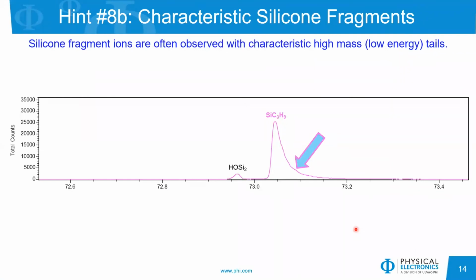Characteristic silicone fragments, generally when you look at the mass spectrum, so this is the C3H9Si peak at a mass to charge ratio of 73, a nominal mass of 73. And you'll generally notice that it has a tail on the high mass side. And this is a very typical observation of some of these silicone fragment ions. It is due to the fact that the larger ions will fall apart in the field-free region of the mass spectrometer. And those have a lower kinetic energy than the ion that shows up at the correct mass to charge ratio. So some of those, the post-source decay, will give this tail to the high mass side. So that's a very common observation.